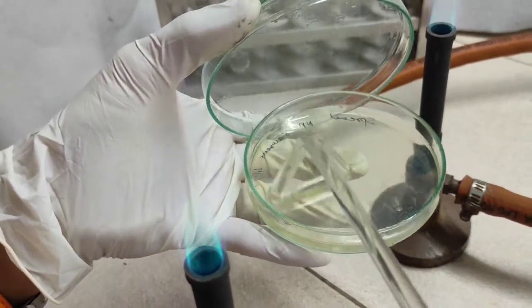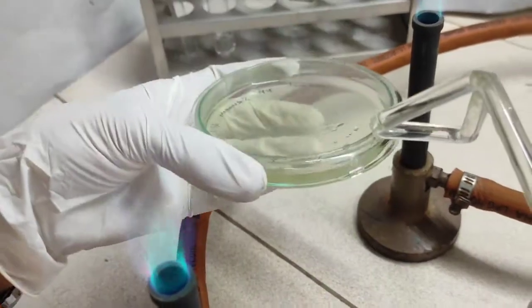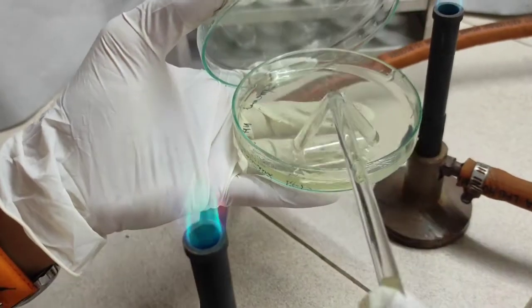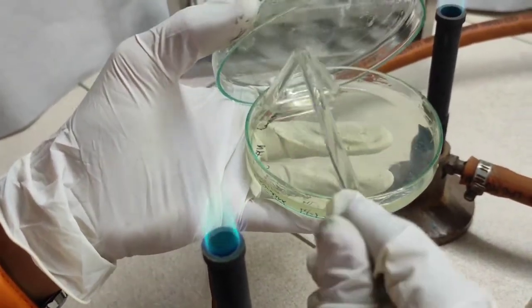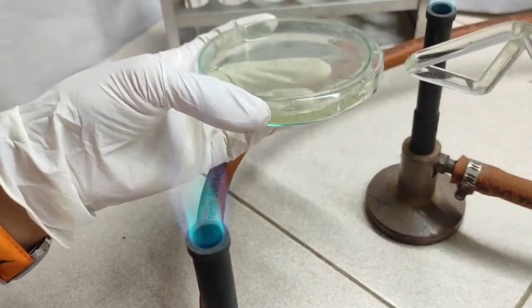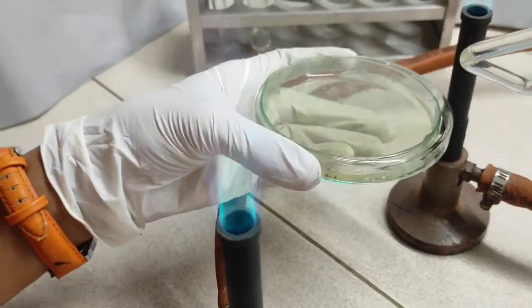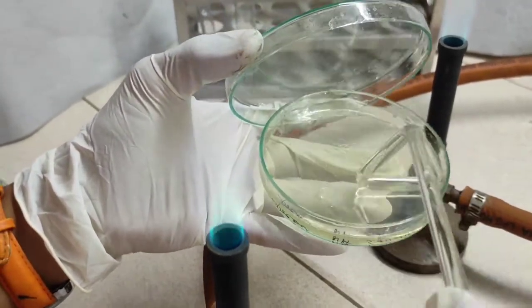You can spread with the spreader like this. The broad part of the spreader is in contact with agar. The idea is to cover the plate as much as possible.